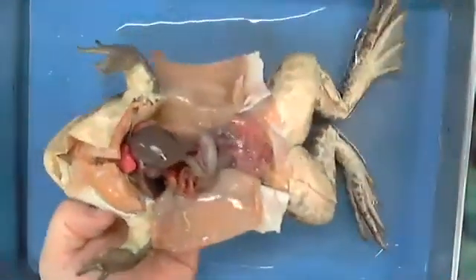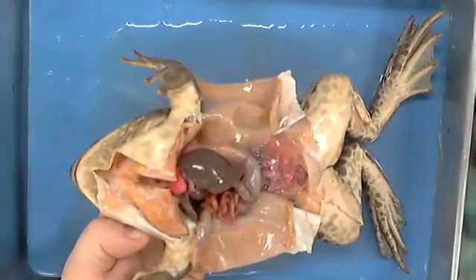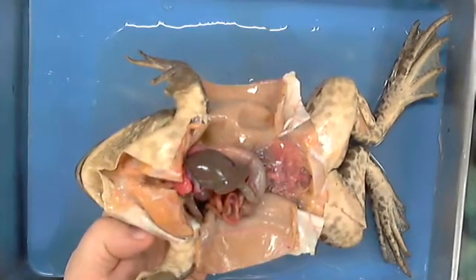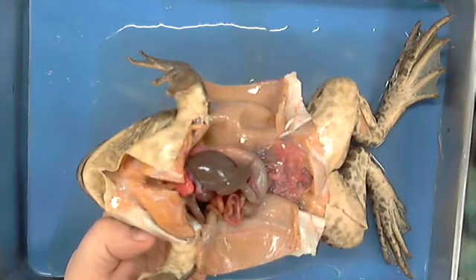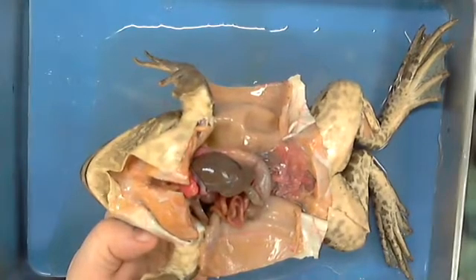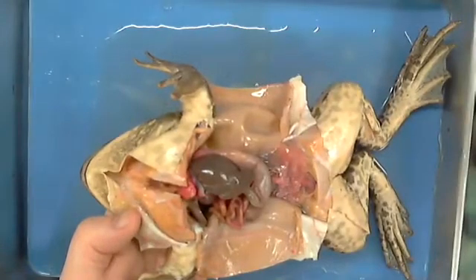If I were to ask you what it works with, what does it do besides filtering? What system is it part of? Urinary. Nope, it does play a role. Circulatory. All right, so we would give it circulatory. What else? Excretory. Excretory is definitely a term that we typically would use for it.